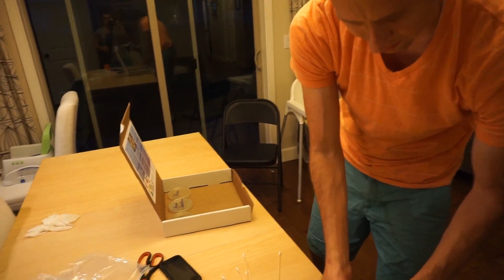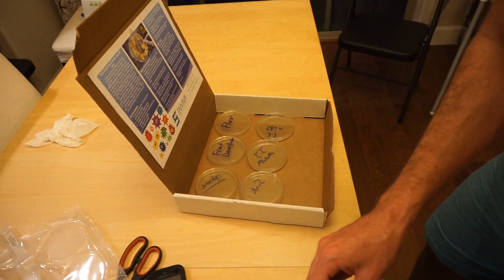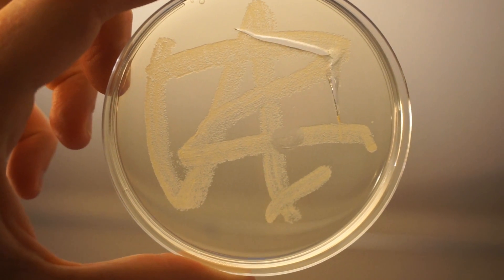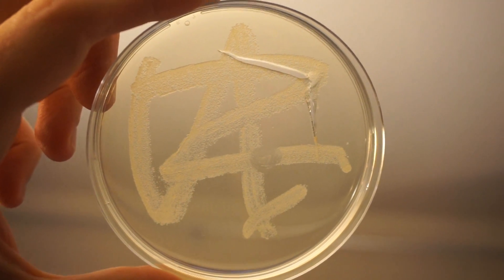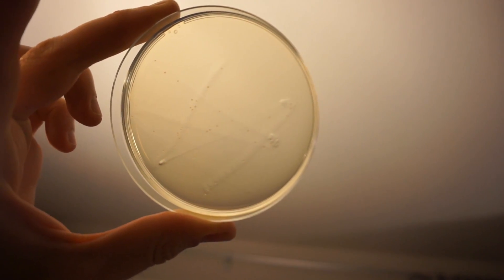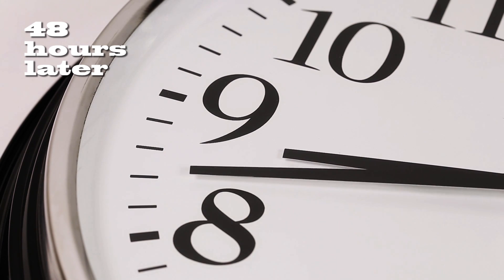You store them upside down at around 84 degrees Fahrenheit for one to four days. We'll check in on them and see how they are. After 24 hours of being in my garage, let's take a look. The sink is by far the dirtiest at 24 hours — it's pretty much covered everywhere that I touched the q-tip to. Next dirtiest is the toilet. Surprisingly clean still is the skin, my armpit, and belly button. Aside from those three, there isn't much growth.